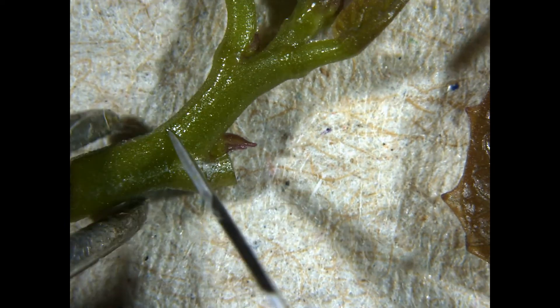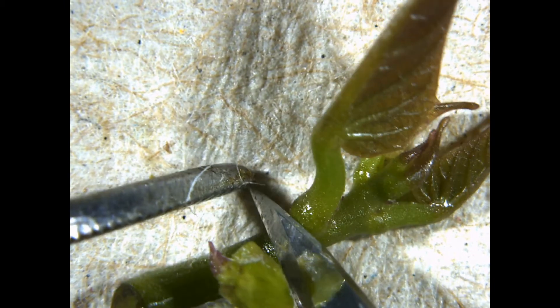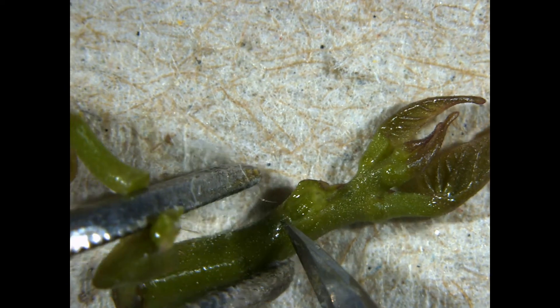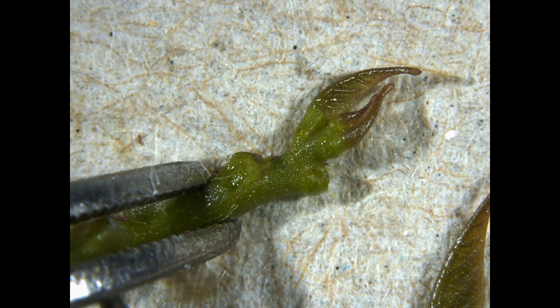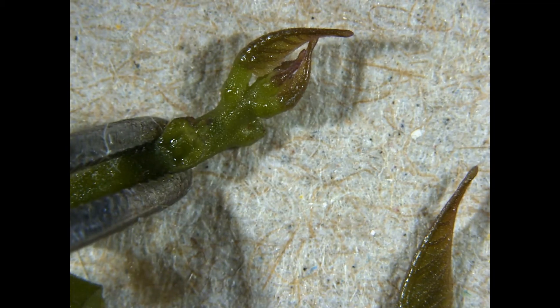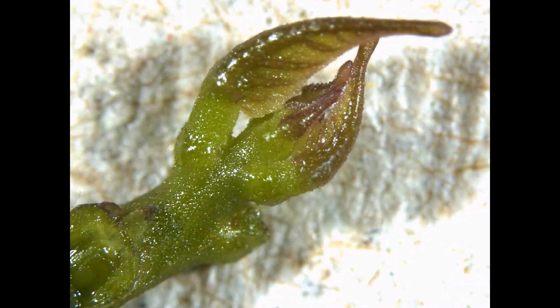Slava starts by trimming away the lower leaves. We like to use the apical buds — they're bigger, and normally sweet potatoes produce more than enough apical buds to use. It's important to use sterile blades for each cut. For the last cut it's especially important to avoid transferring any virus on the scalpel blade from the older tissue to younger tissue.